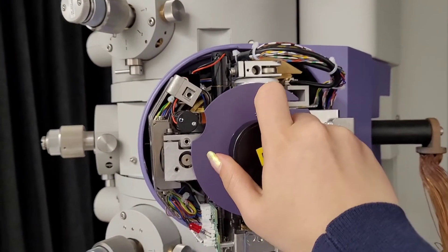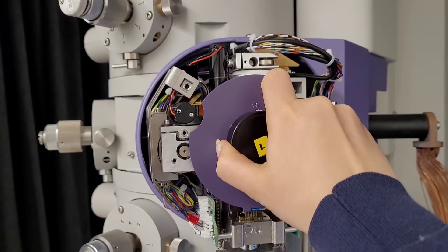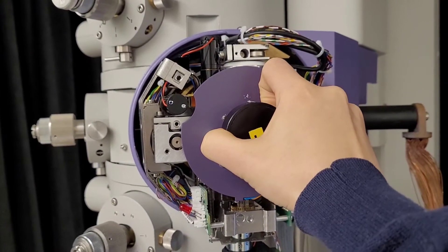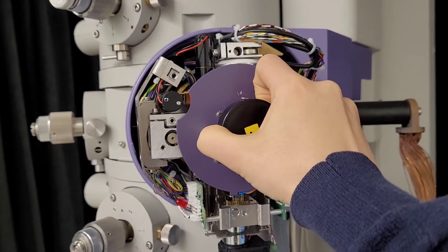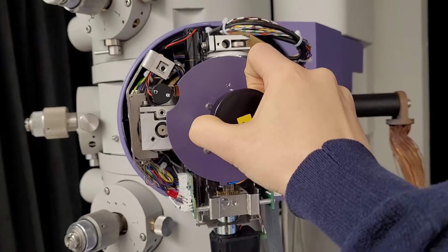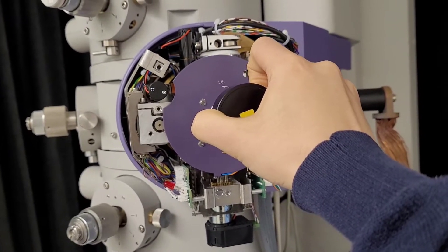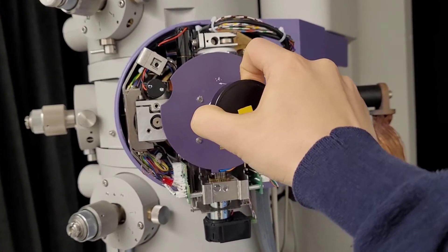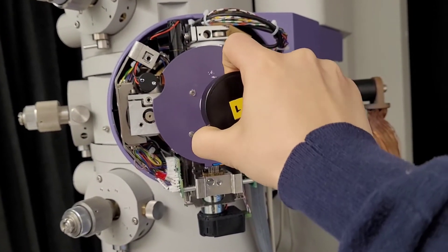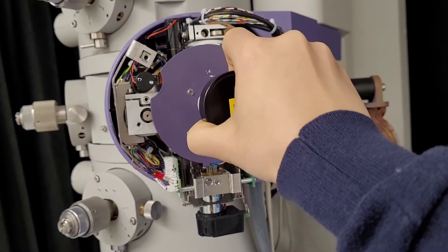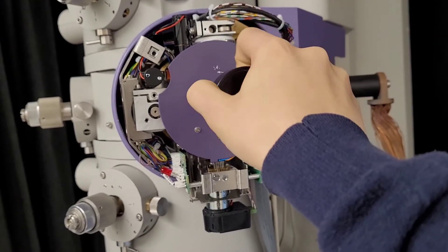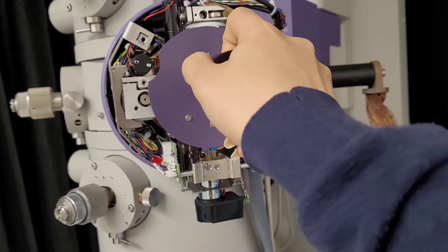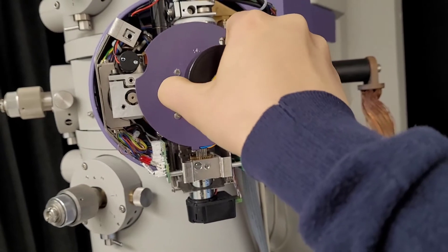and select the column valves again. Then you have to take it straight out as far back as possible until you can't take it out anymore, and then you twist it clockwise.